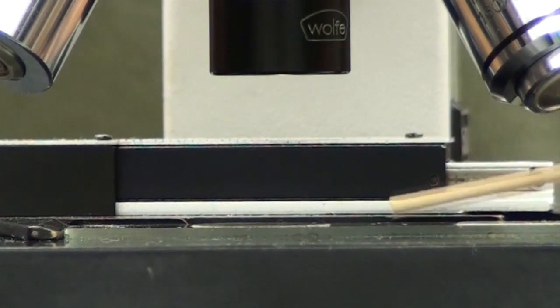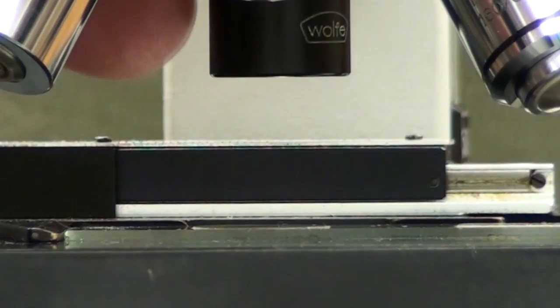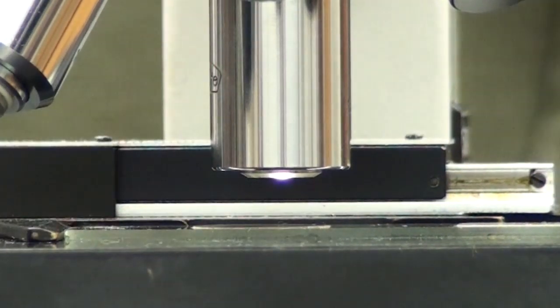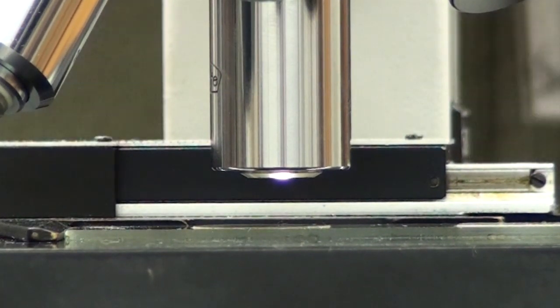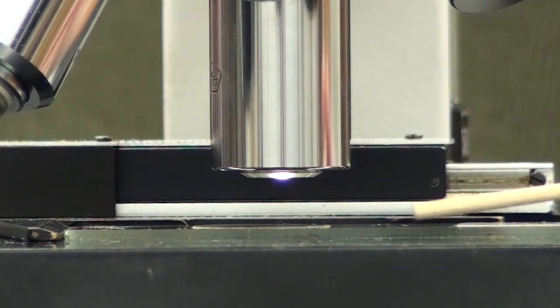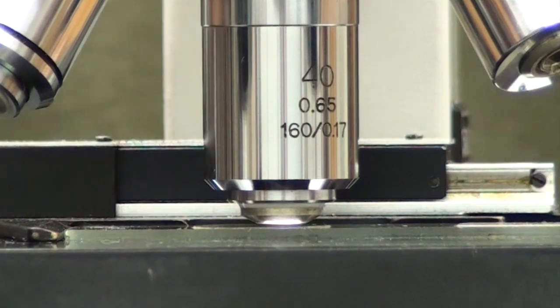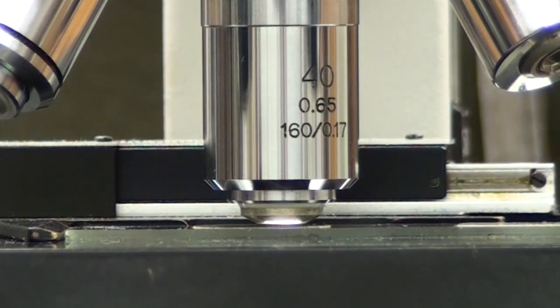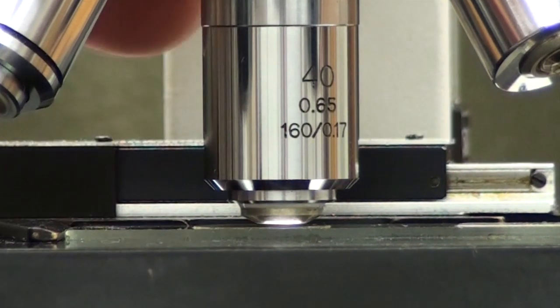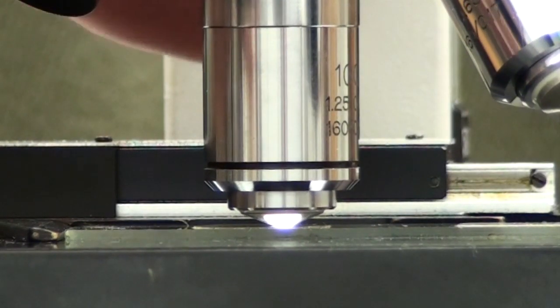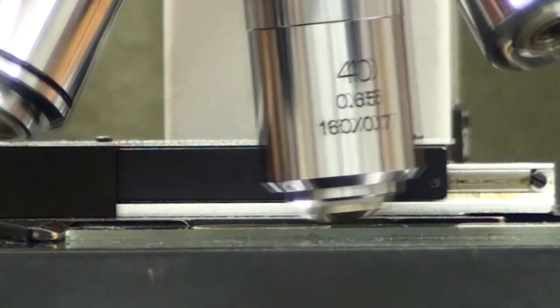Here's the slide. This is in focus now under 4x. Click. This is what's in focus under 10x. This is what's in focus under 40x. And the oil immersion, so you can kind of see it's right against the glass.